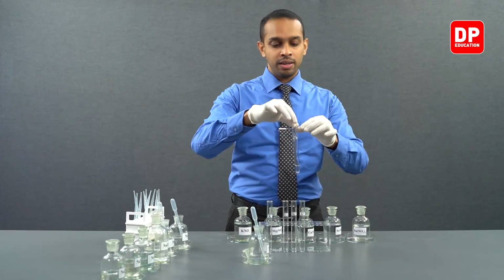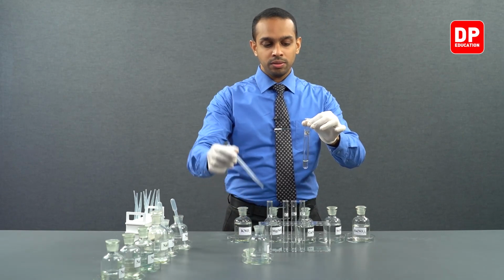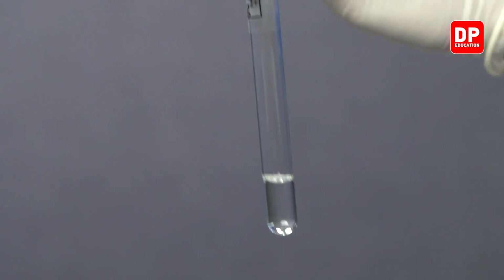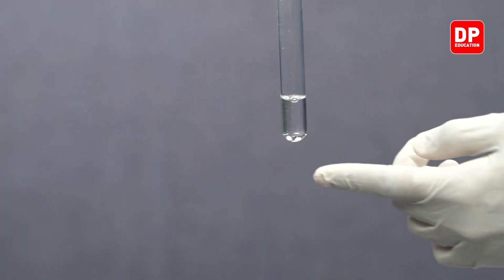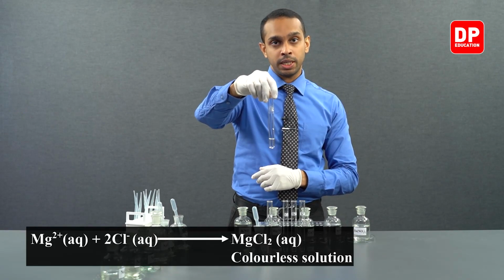Now we have our magnesium 2+ ion solution. To that also let's add a few drops of chloride ion solution. You can see upon addition of a few drops of chloride ion solution, we did not form a precipitate.